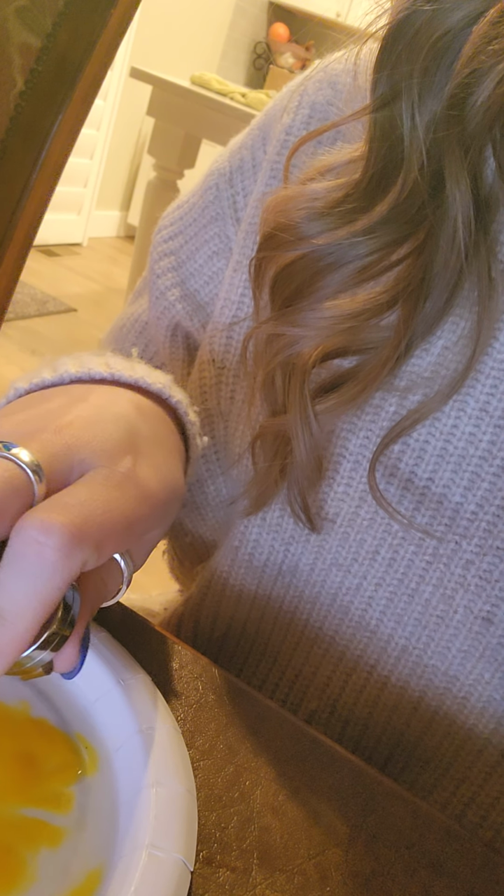So here is my solution, which is yellow because ink toner was not an option, so I tried to find something similar. I got ink for the printer, which was yellow, and obviously that wasn't the right thing. But my magnet, as you can see, is doing nothing. So obviously the fact that I didn't use ink toner was probably the main issue in this and why it didn't work.